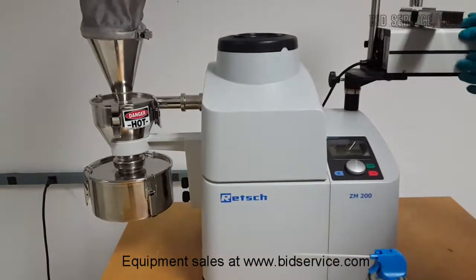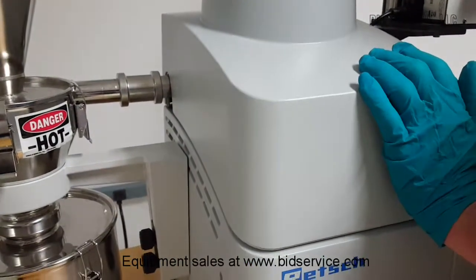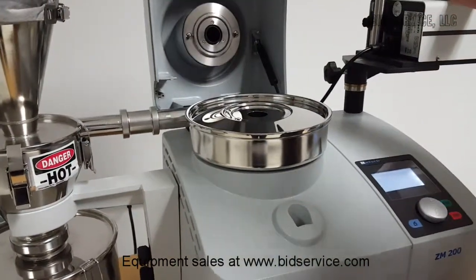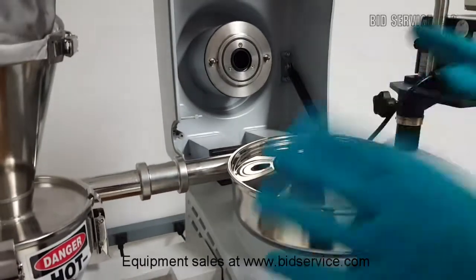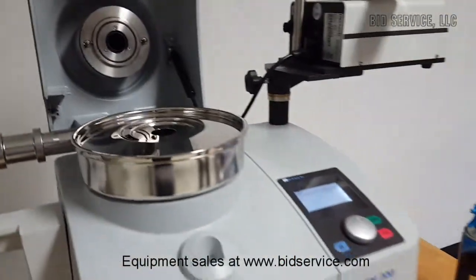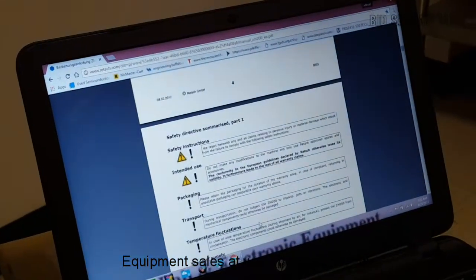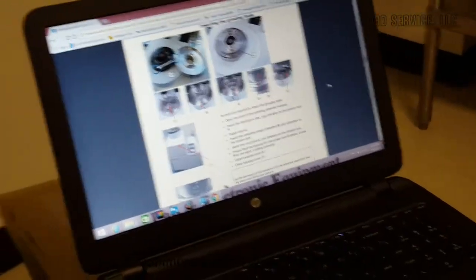Before we start it up, I'd like to show you a few things. To unlock it, we'll power it up. I'm going to open the cover here. Considering that this has to be very clean for different applications, it is suggested that you always wear gloves when you touch the surfaces. The user's manual is very good and gives a step-by-step display of how to take it apart and use it. Right here is how you take apart the inside, and I'm going to demonstrate how to do that.